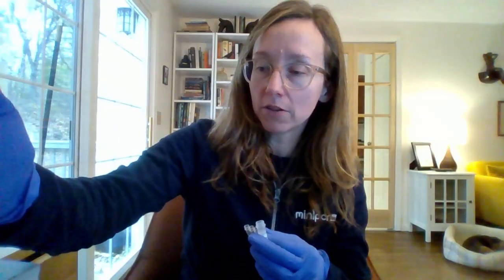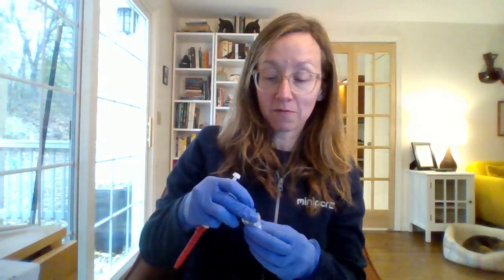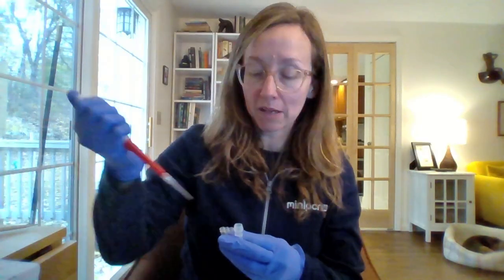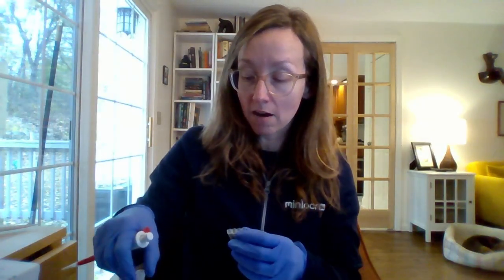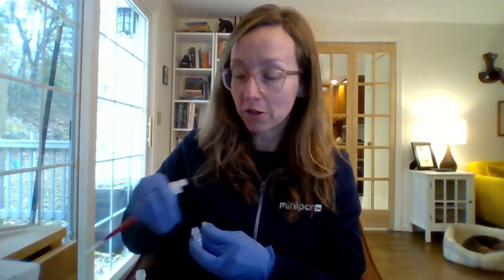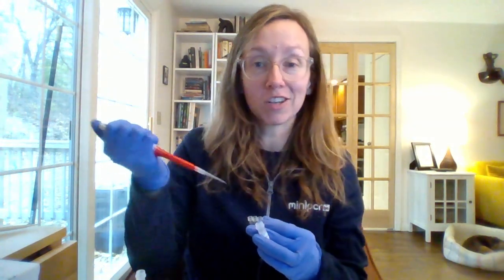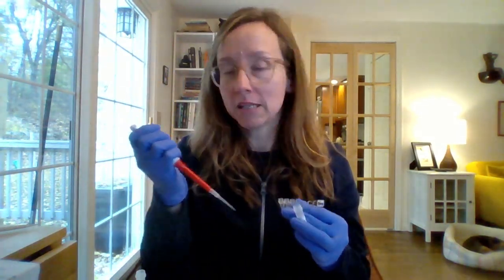And even for those who are comfortable pipetting, there's a few things to know about pipetting into BioBits pellets that I want to call out here. So as I mentioned, BioBits pellets, they're freeze dried. And so they are super hydrophilic. When they come into contact with moisture, they want to go toward it. So if I take my pipette tip here when I'm adding reagents and I touch it directly to the BioBits pellet, the pellet is going to try to jump up into my pipette tip. I don't want that to happen.